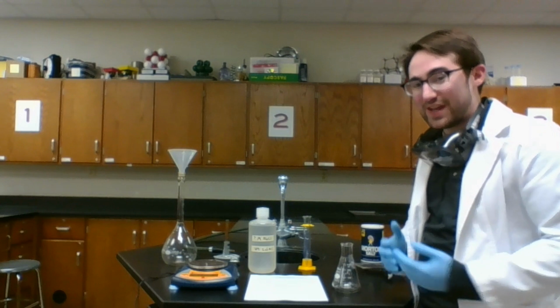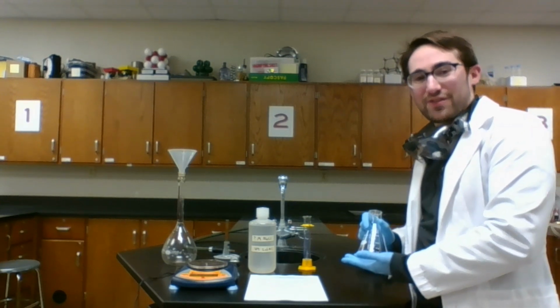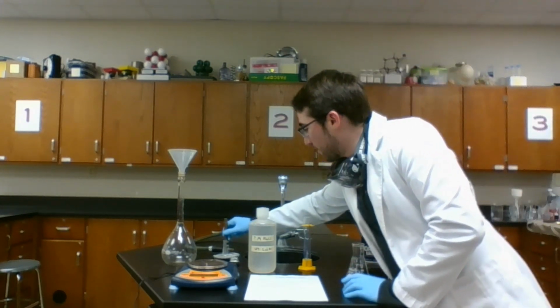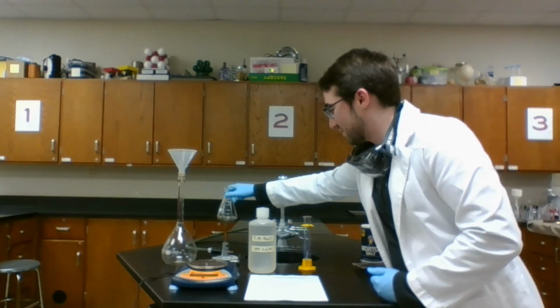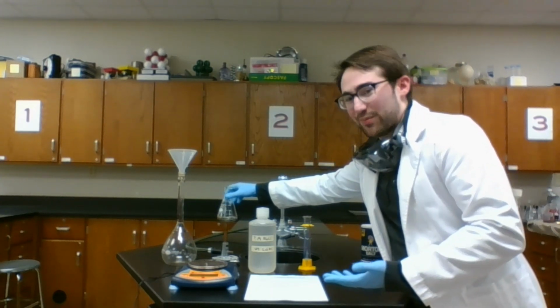Now, I'm going to need to heat this up somehow, so I could use a hot plate, but I'm a little too impatient for that. We're going to use something a little bit faster, can run a little bit hotter at the rate that we want it. We're going to be using a Bunsen burner. Right? So if I want to heat this up using a Bunsen burner, I can't just set it on top of here and kind of hope it balances, because then I'm going to block the gas flow.